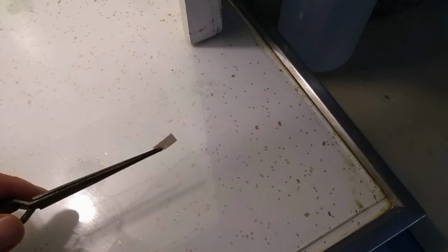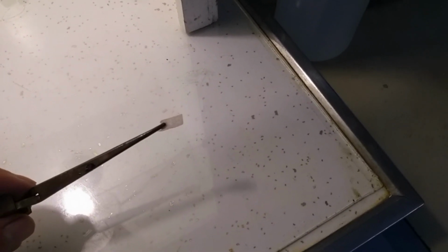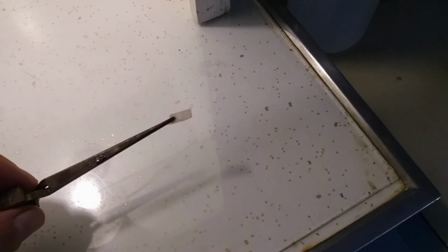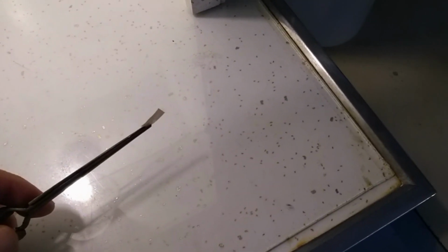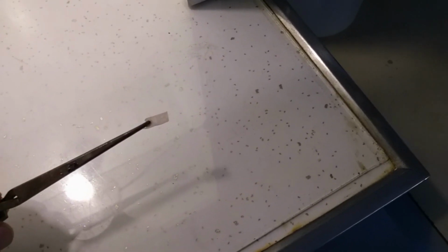I did throw some lead acetate paper at the mouth of the test tube with the gas coming out. It did turn dark, so that's indicative of a sulfide, which would be the case if it's either pyrite, chalcopyrite, or galena. But I just wanted to check. The metallic color of the mineral is also very indicative that it's a sulfide.